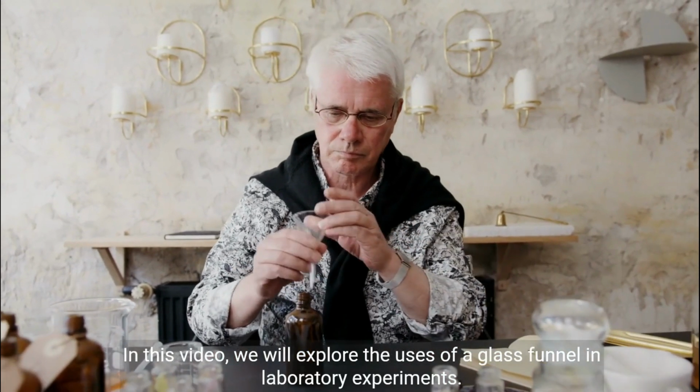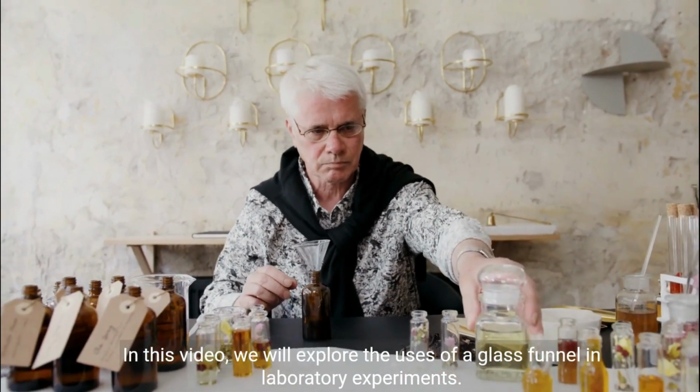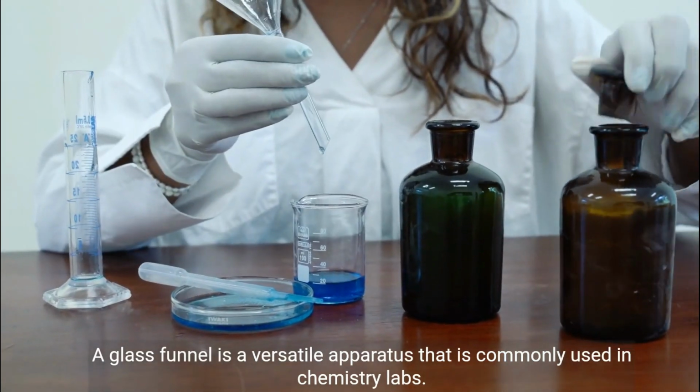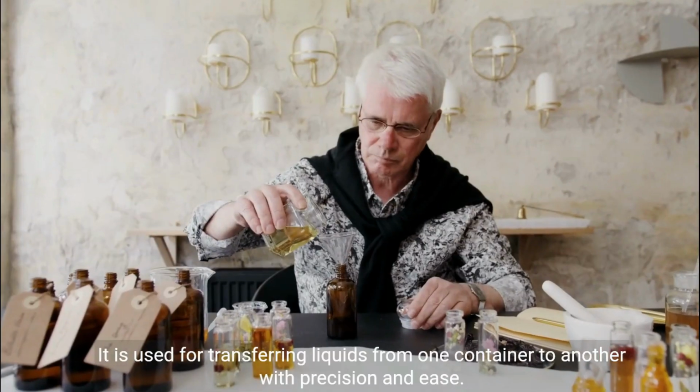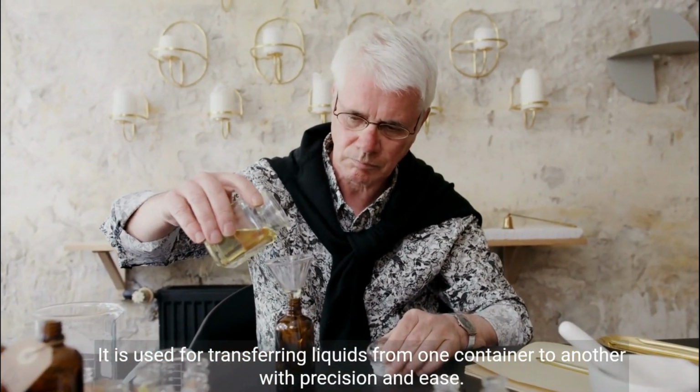In this video, we will explore the uses of a glass funnel in laboratory experiments. A glass funnel is a versatile apparatus that is commonly used in chemistry labs. It is used for transferring liquids from one container to another with precision and ease.